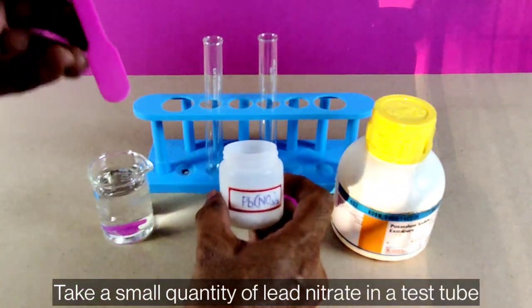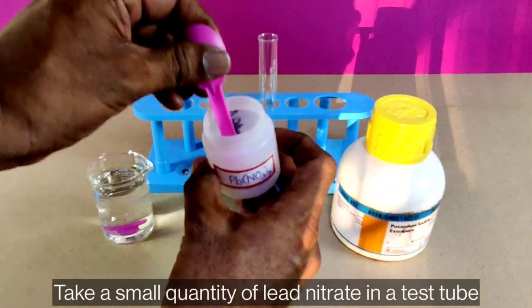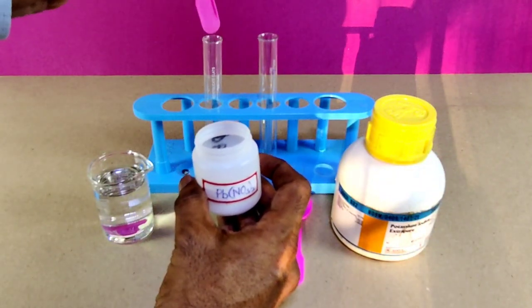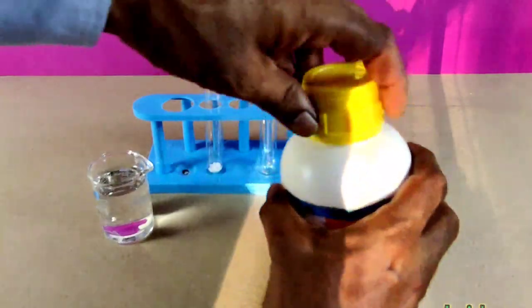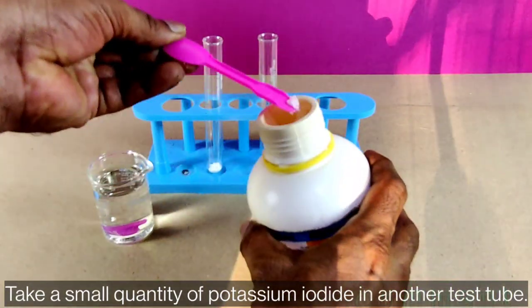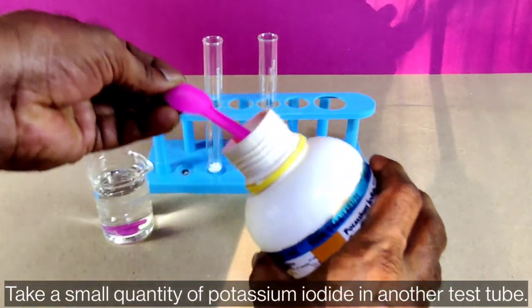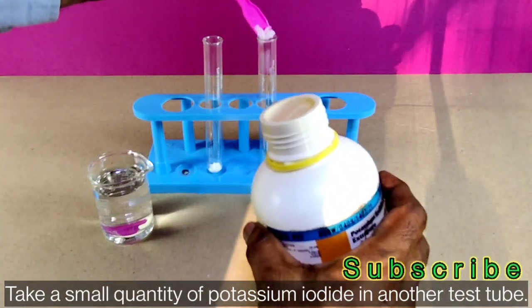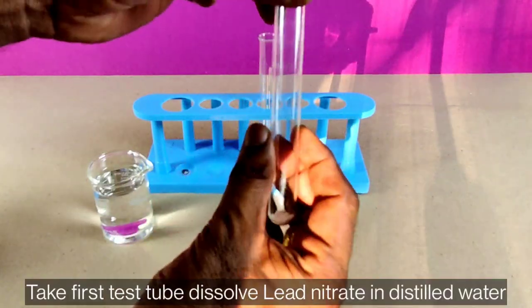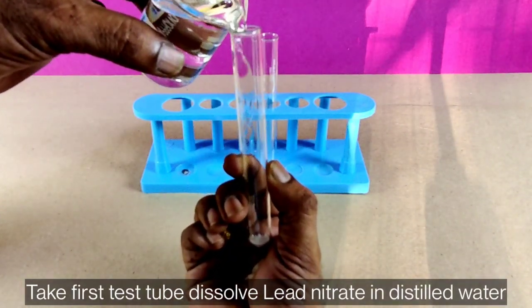Take a small quantity of lead nitrate in a test tube. Take a small quantity of potassium iodide in another test tube. Take the first test tube and dissolve lead nitrate in distilled water.